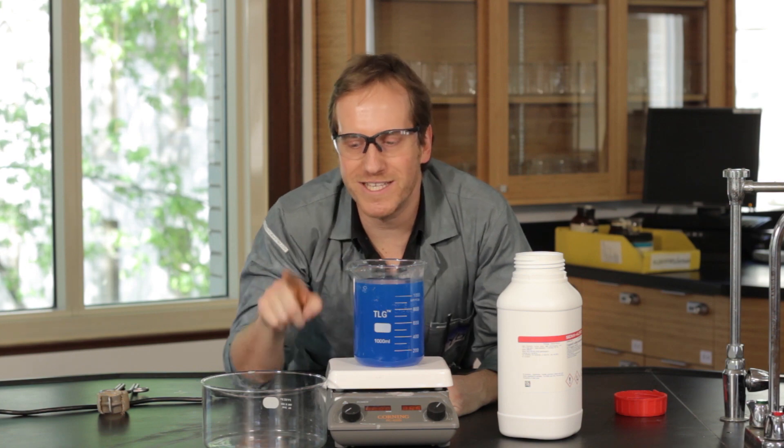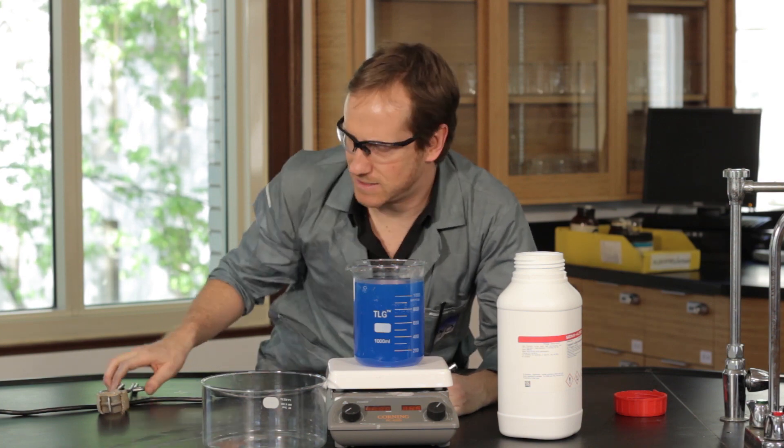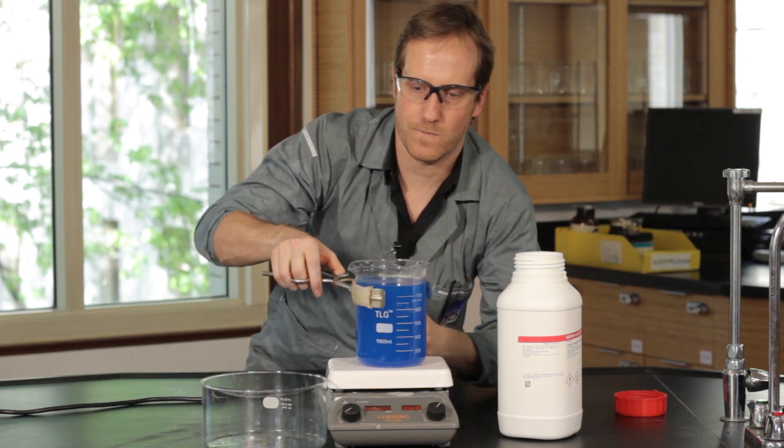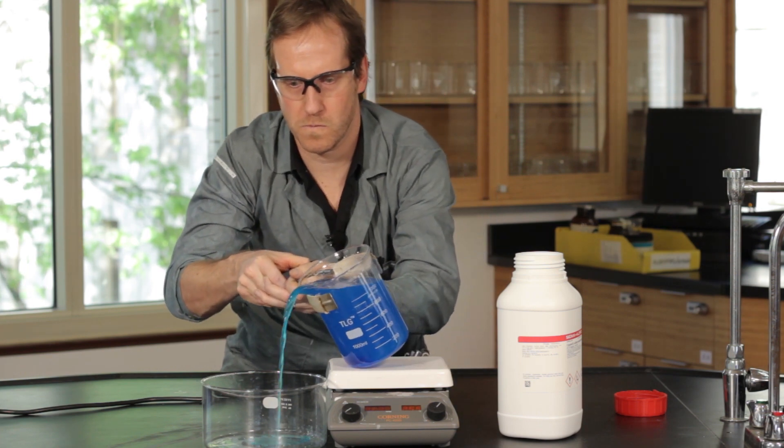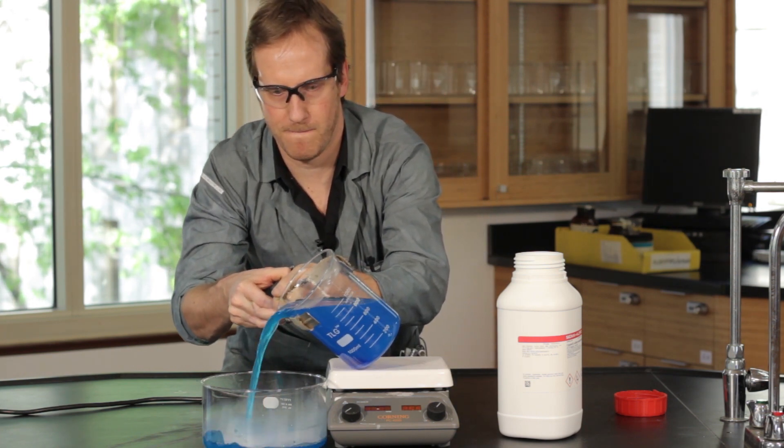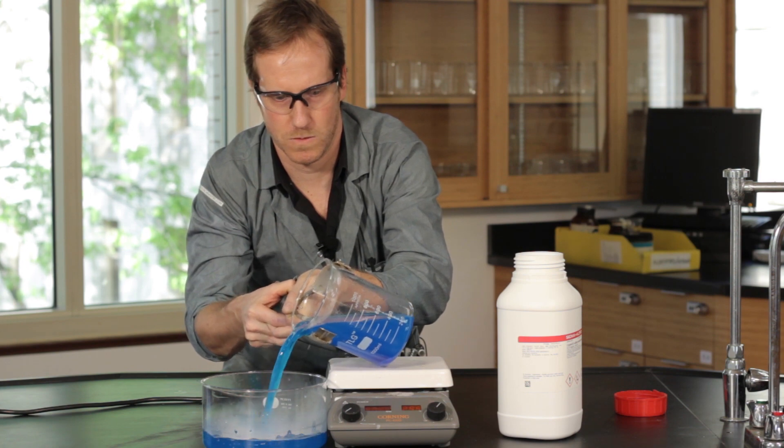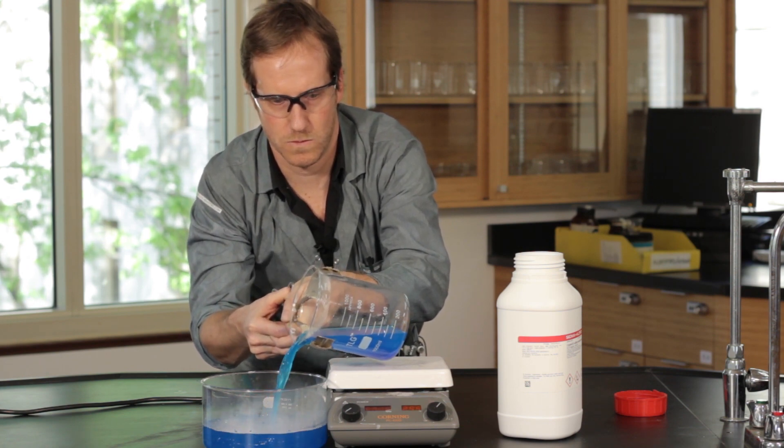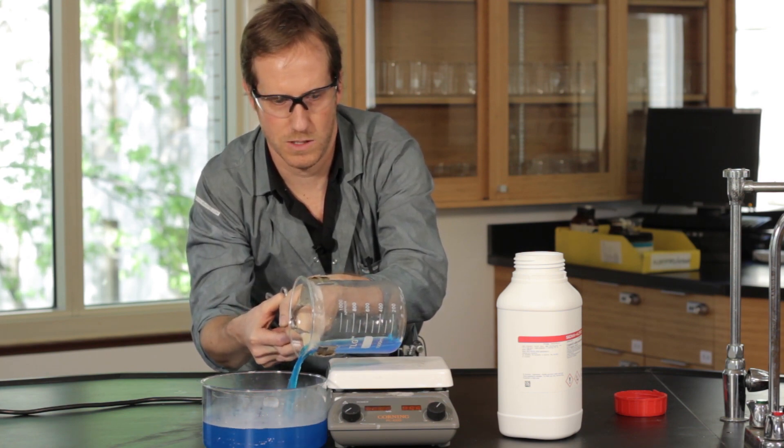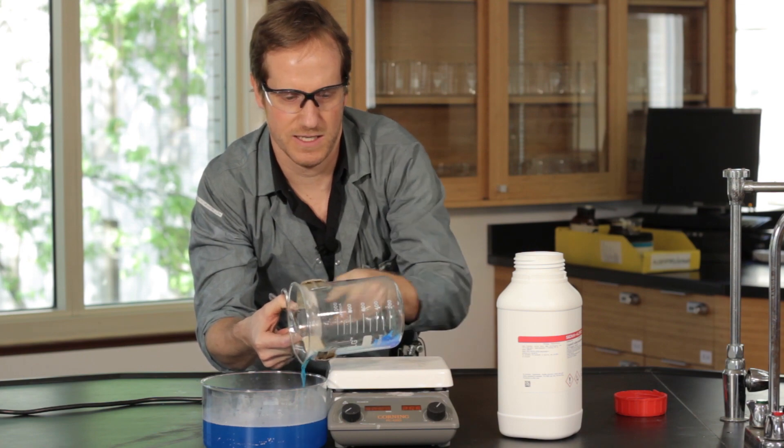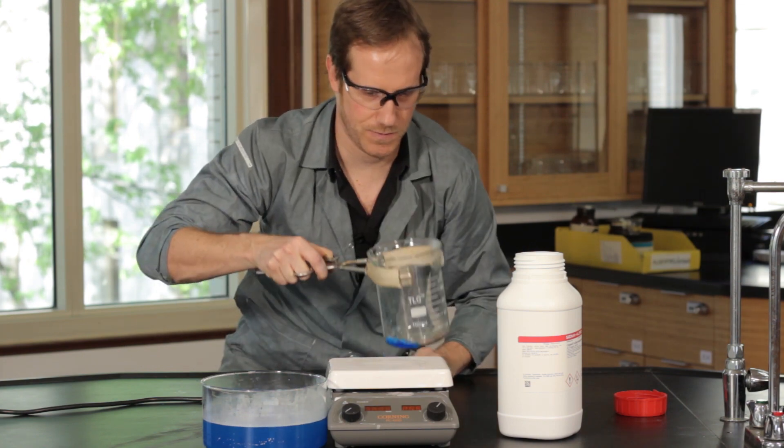What we want to do is to put only the liquid inside the Pyrex glass. Whatever is left of solid stays inside here. Perfect.